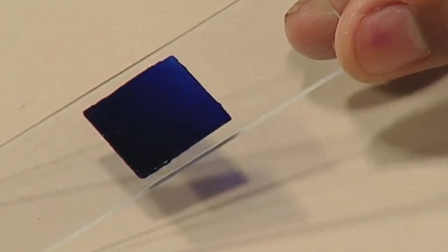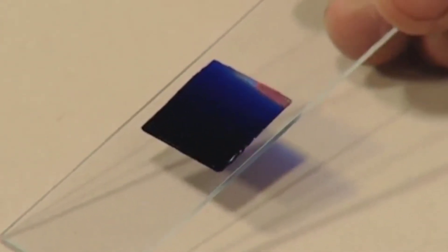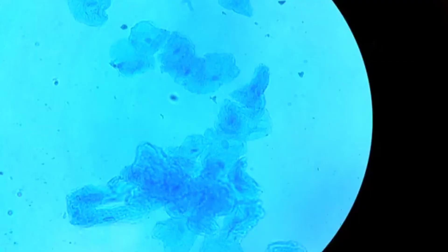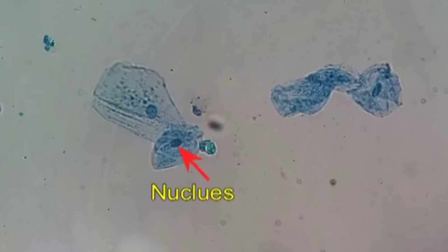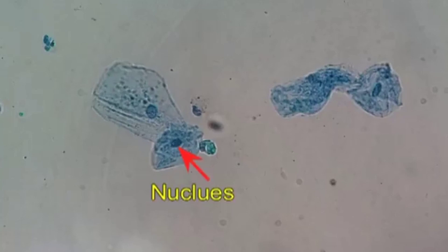The slide with cheek epithelium cells is ready. Now we will be observing it under the compound microscope. Take the microscope and place the slide on the stage. Fix the slide and observe it under low power. When we study the slide of cheek epithelial cells, we observe that the cells are irregular in shape and are stained blue in colour. These cells are widespread and also show a centrally located nucleus.